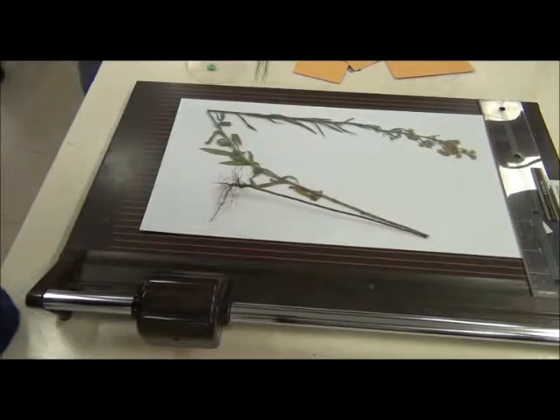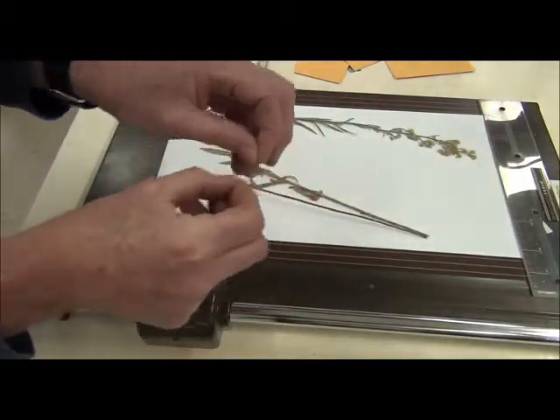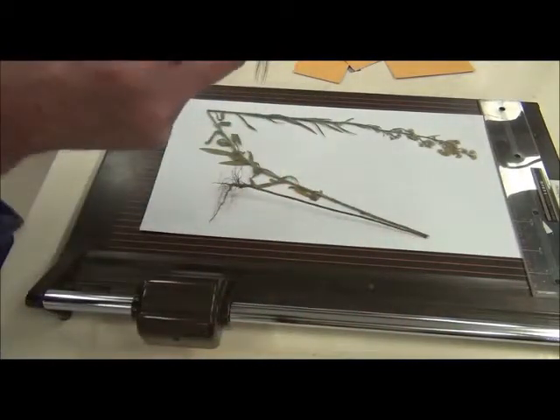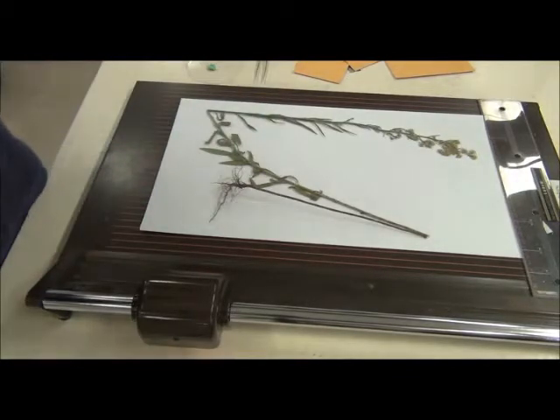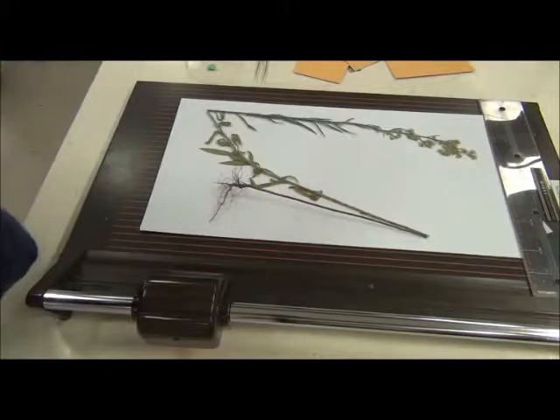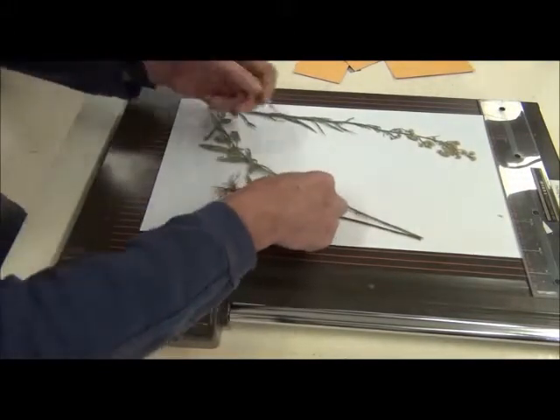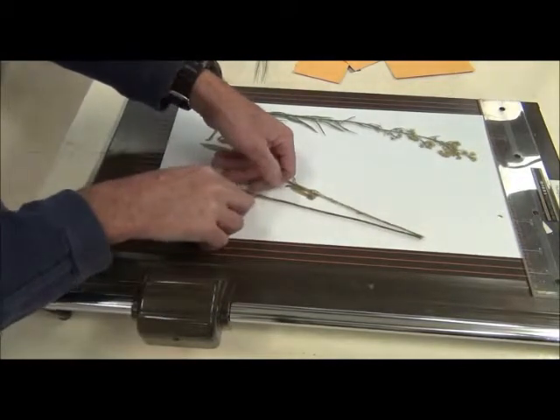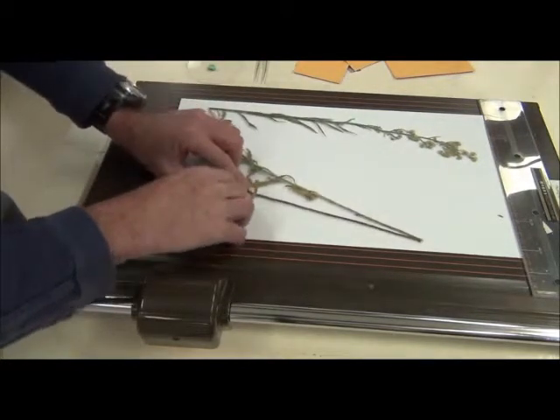So it's all about that sort of approach. Now, with this glue you can either have the sort of, like they have in the shops and banks, something that allows you to wet down, wet the back of that. I'm actually going to just lick it because it's non-toxic. And near the base I'm going to put the tape down on one side. Now, what I want to avoid here is making a tent.